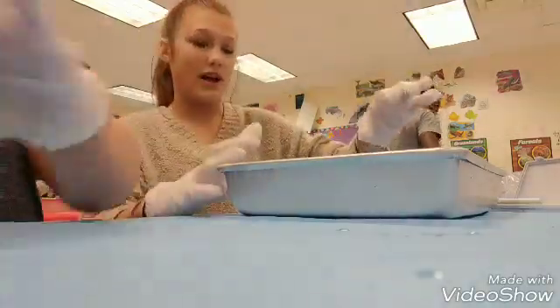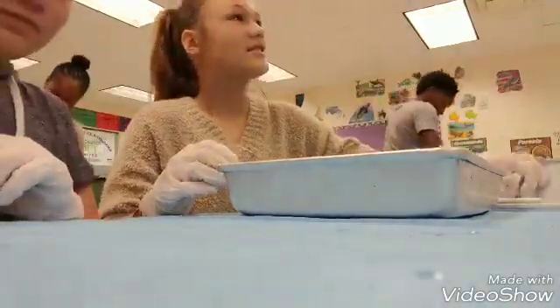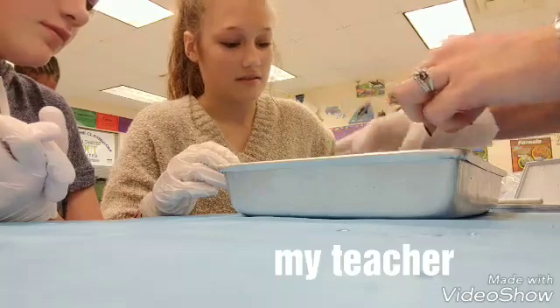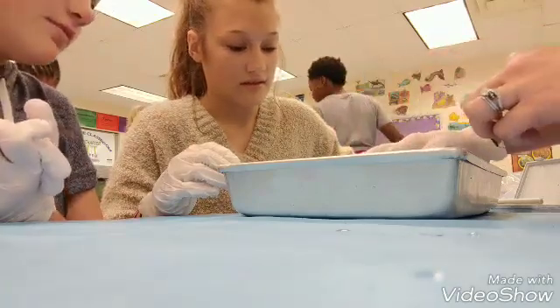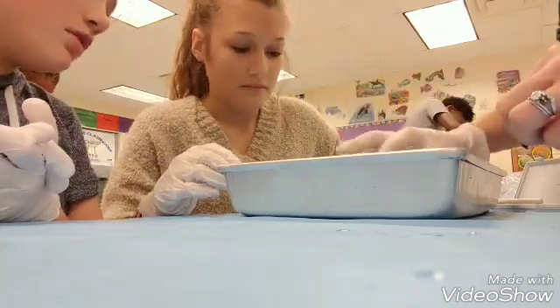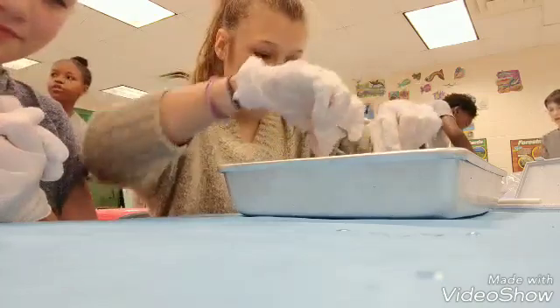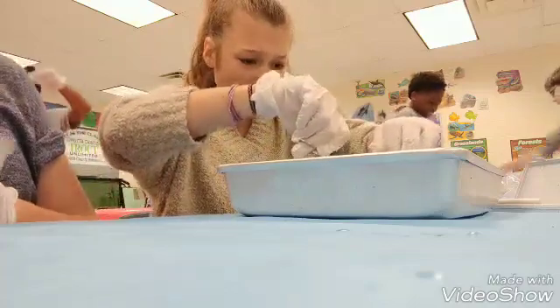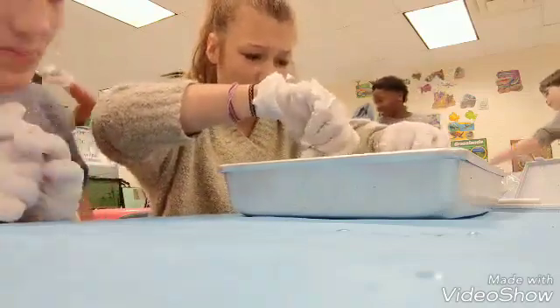This is not working for me. I took this spot. This is not working. Did they say what to do? Where's the small intestine? He said he wanted to cut. Well, this is the liver. Those three things are the liver. The heart is right there. And then the intestines are going to be under the liver. So you might want to clip that out. We're in a problem. What is the side color? What is... because we have to get this out? Ew, it looks like an artichoke leaf. This might ruin artichoke leaves for me.